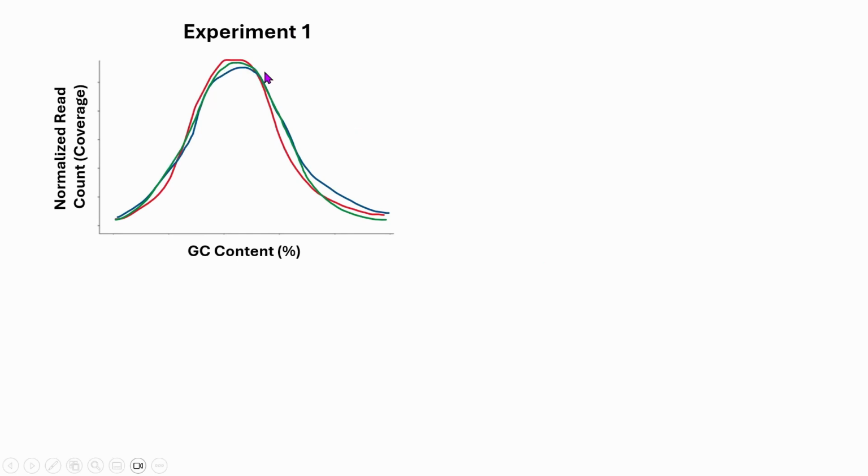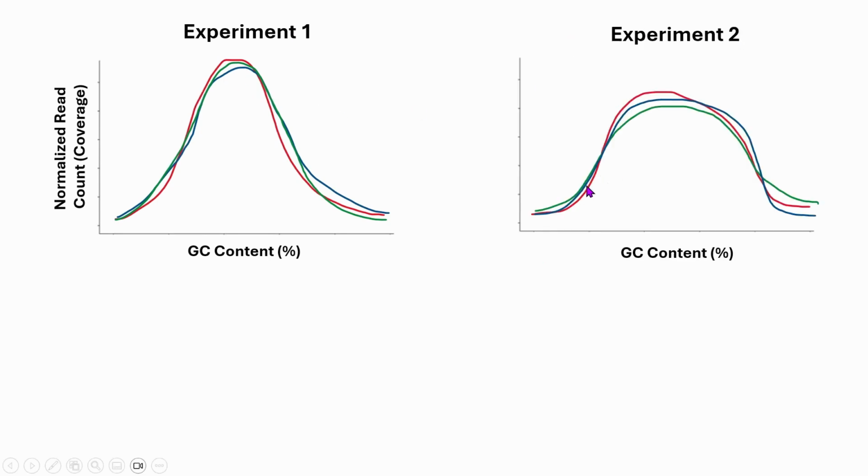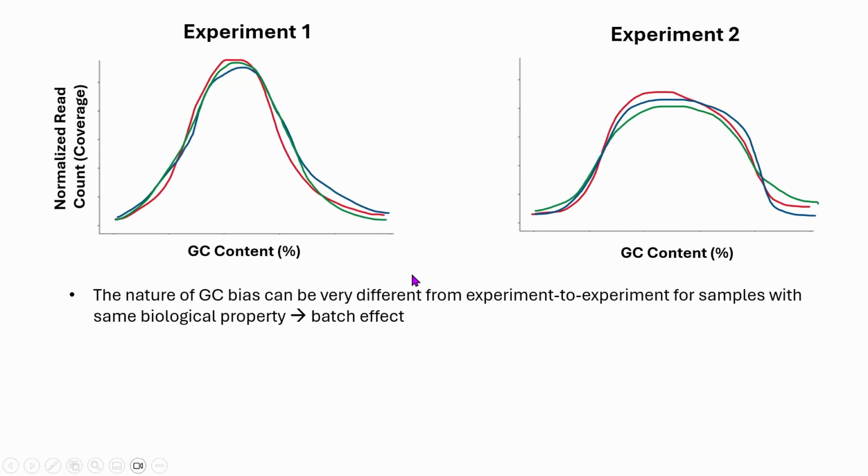But if we take those same three people and do the sequencing in a different lab or in a different environment, then the GC bias curves now look very different. This is a very common phenomenon, and it is called batch effect. Batch effect refers to a phenomenon where some curves or some analysis are very much influenced by the difference in environment rather than the difference in biological property. And GC bias is one of the core backbones of the batch effect, which makes machine learning modeling very difficult to generalize. So just to summarize, the nature of GC bias can be very different from experiment to experiment, and this is called batch effect, which we are showing right here.